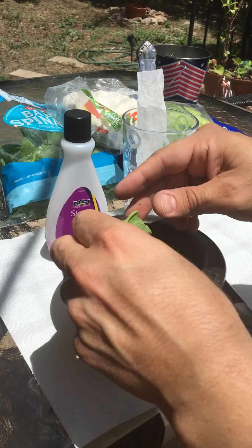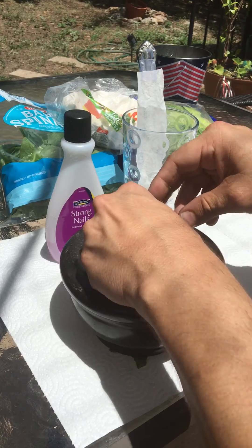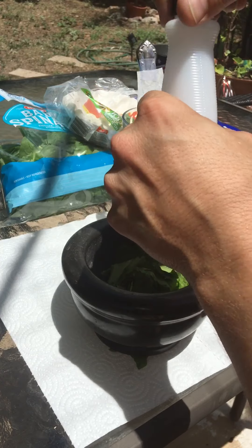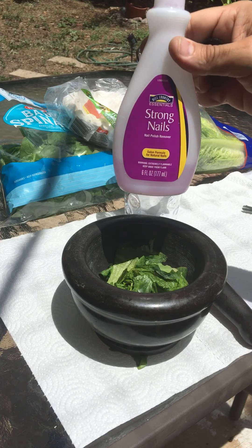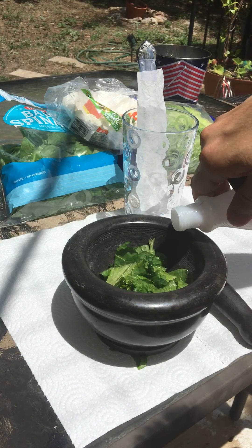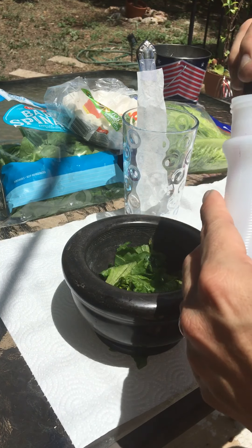We're trying to release and extract these pigments through something called chromatography. The next thing we need is a solvent. The solvent here is a little bit of fingernail polish remover, which is also known as acetone for you chemists out there. So I poured a little fingernail polish remover in there.